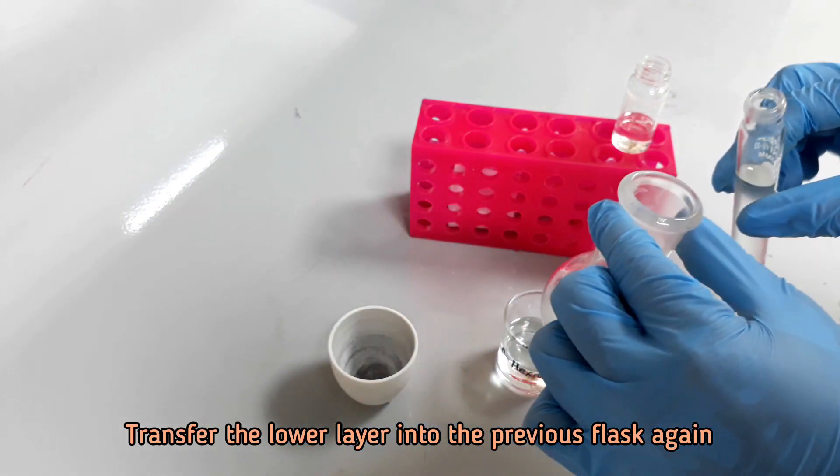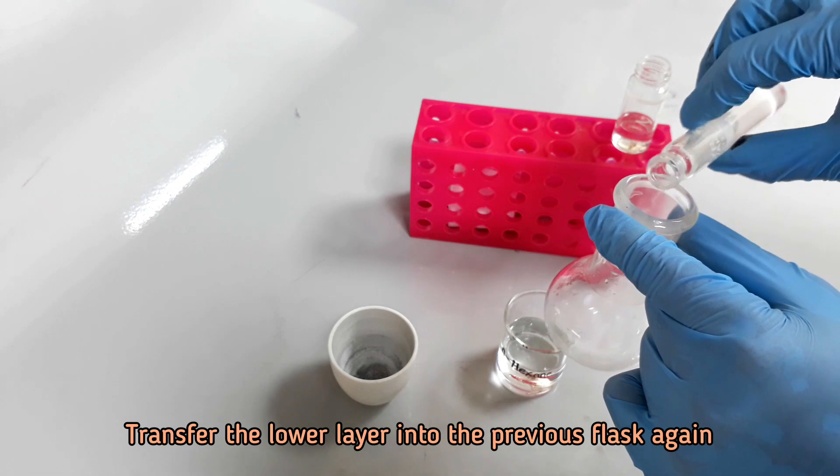In this way, collect the hexane extract for the third time using another 4 ml of hexane.